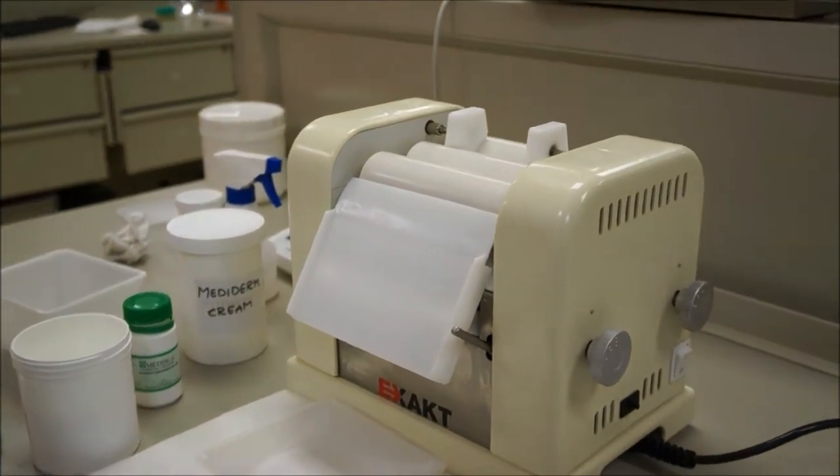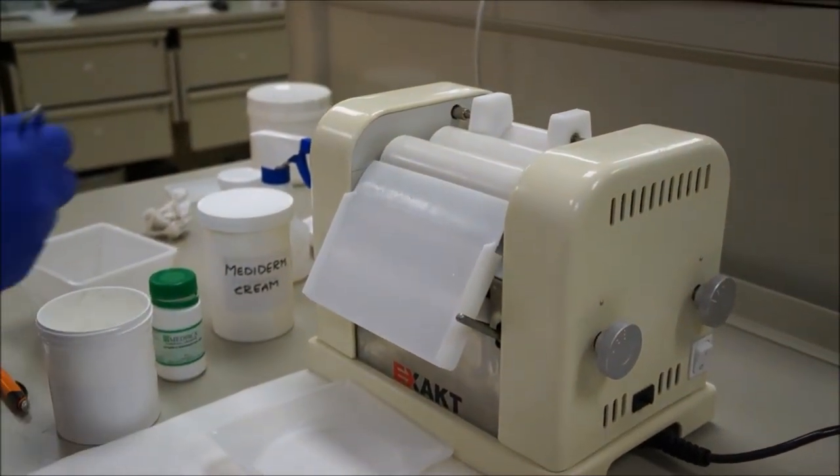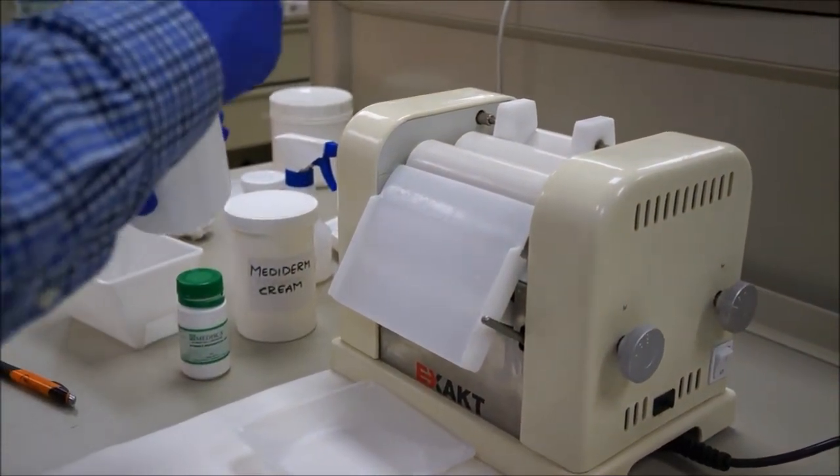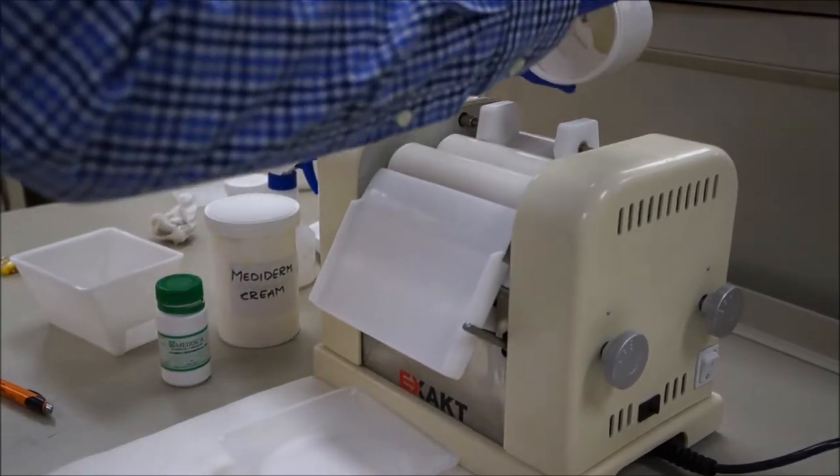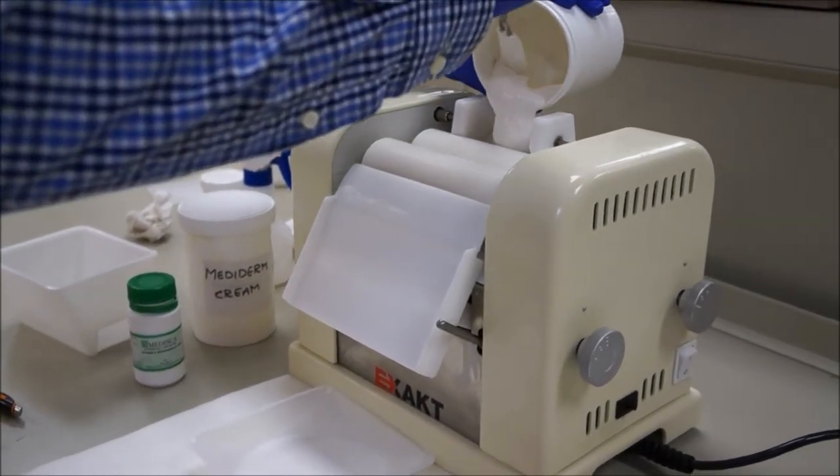Now make sure you're not wearing a tie or anything. It's really easy to get your hair or anything else caught in there and it will rip it through. You can't stop it, so be very careful with this machine.